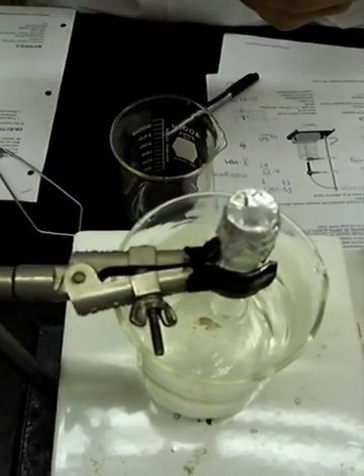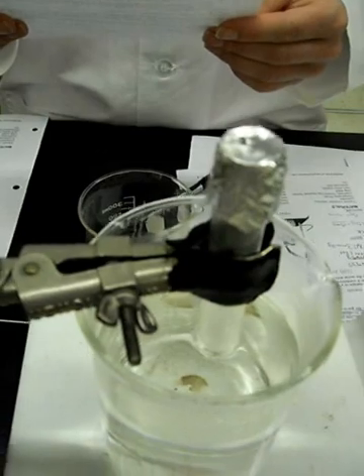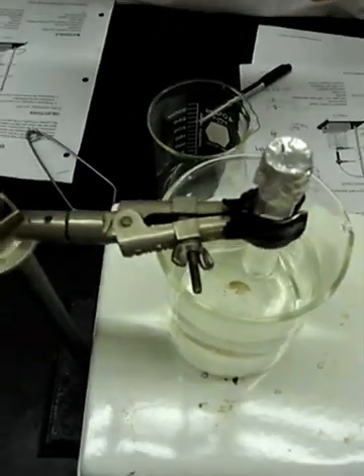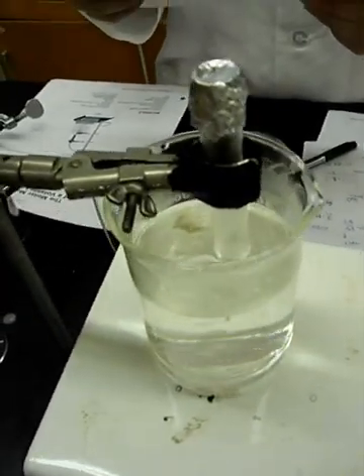Note that some of your sample will escape the test tube through the needle hole in the foil. This process also serves to flush the air out of the test tube.